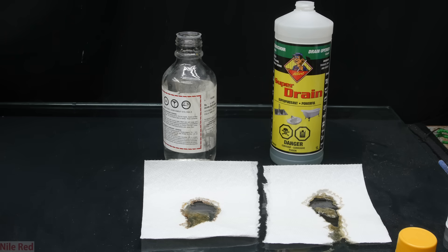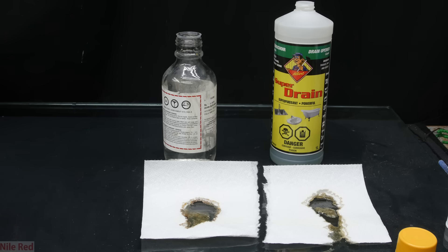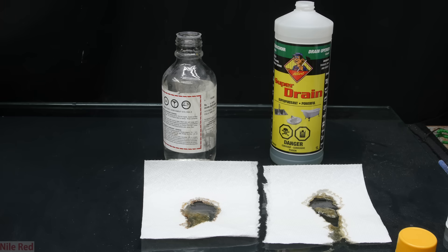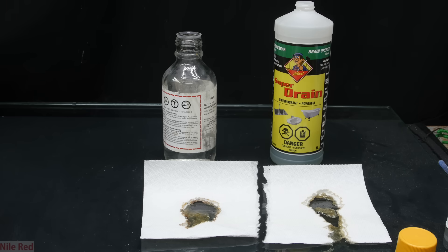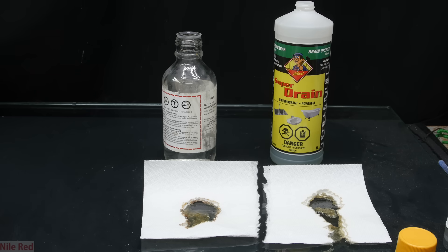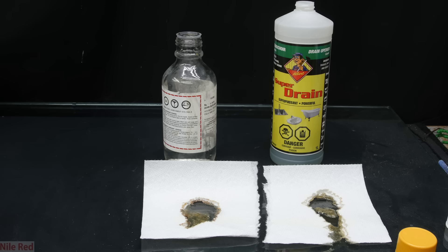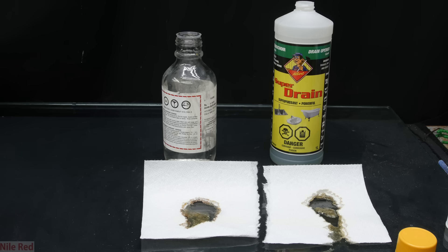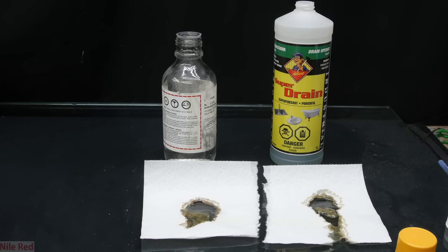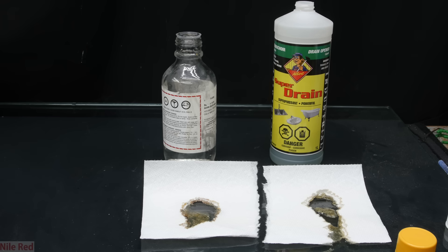In conclusion, there are two major methods to clean up sulfuric acid, and I think the distillation method is superior — both in purity and safety, because we're not going to be pumping sulfuric acid into the air. Also, apparently the peroxide might not be required, at least for the drain cleaner that I used.